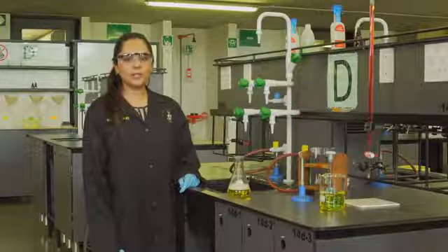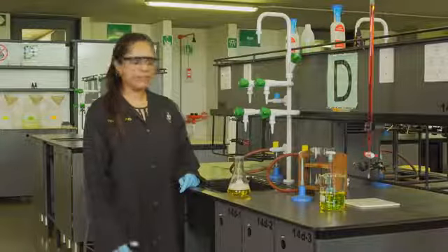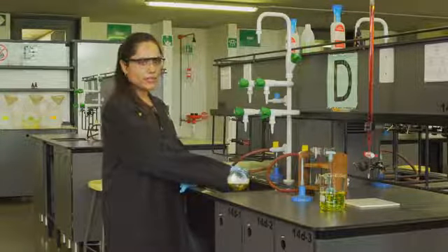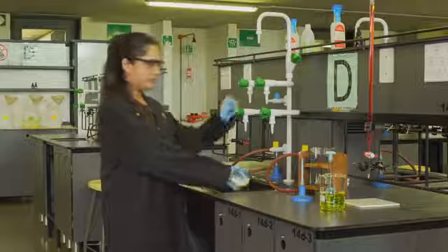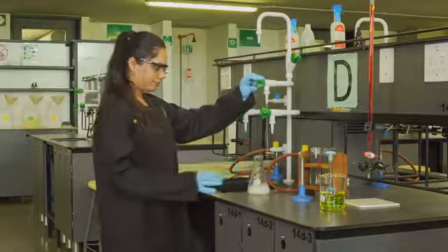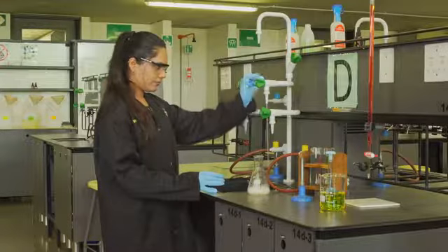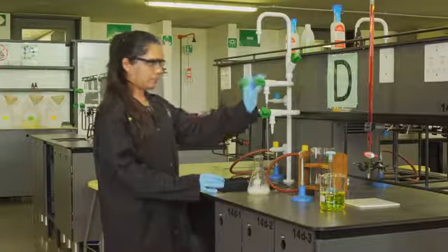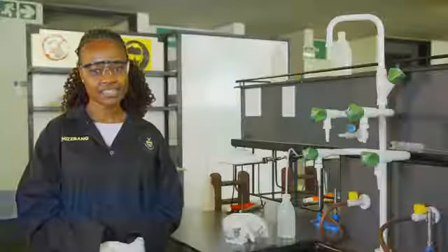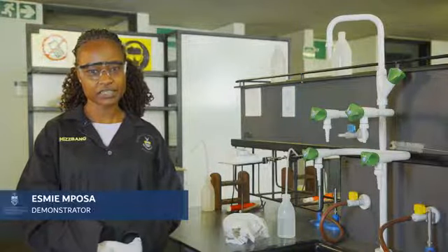Drain disposal may only be used for non-hazardous chemicals, provided they are flushed down with ample amounts of water. Non-hazardous waste material can be thrown in the dustbin.